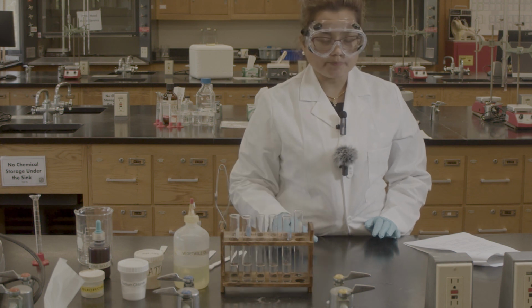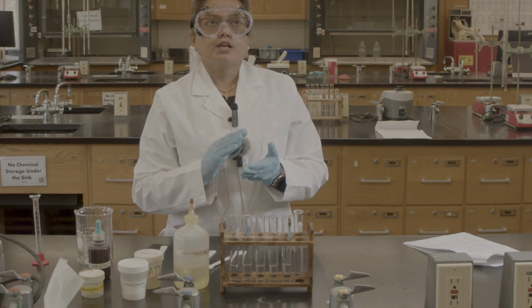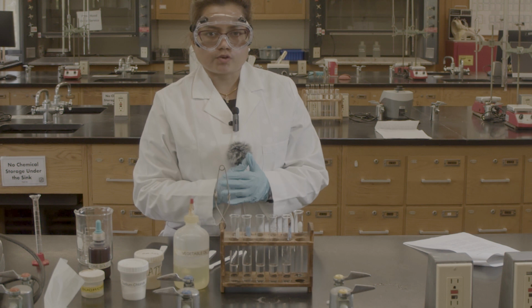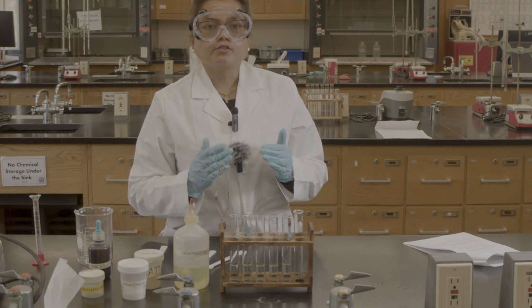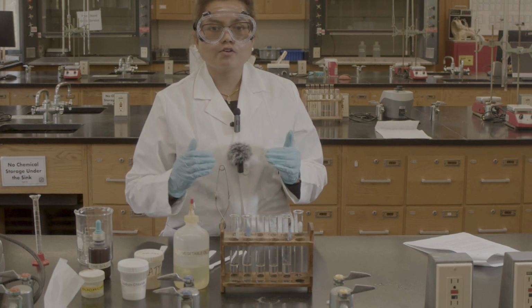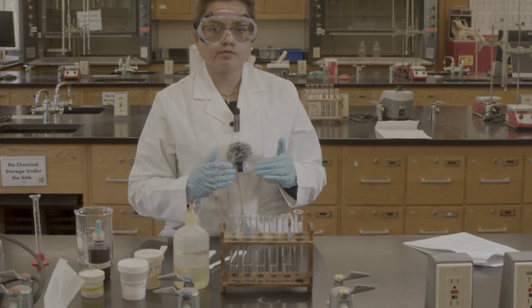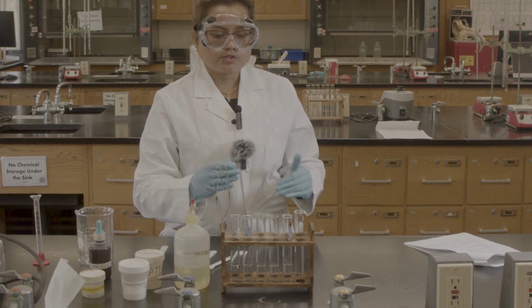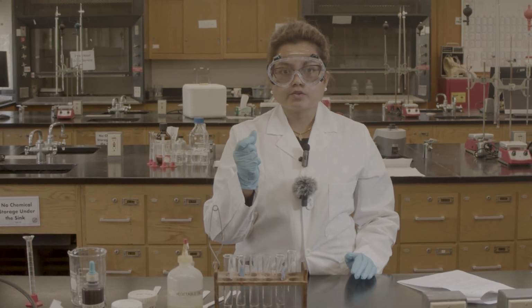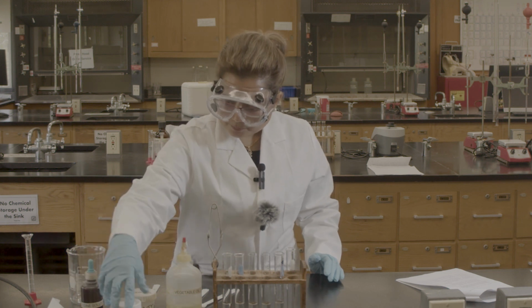What we are going to compare: we will use the water. Water is polar, and we have to see that. Solubility happens when polar attracts polar and non-polar attracts non-polar. When we have polar and non-polar, it doesn't dissolve, it's not soluble, and it creates a layer that you can see. Okay, so we will see now.